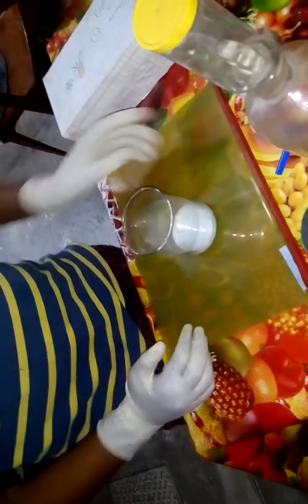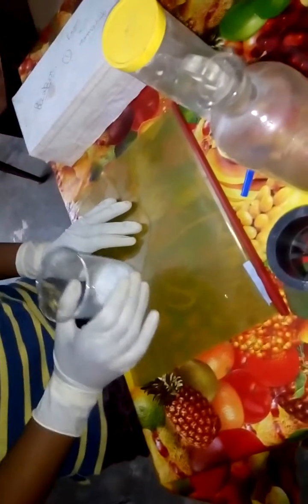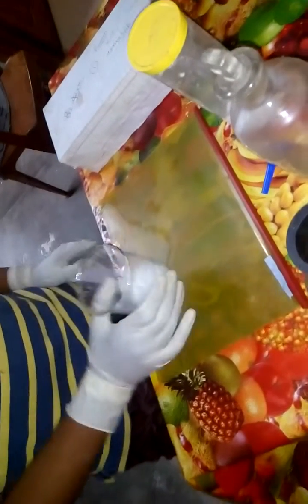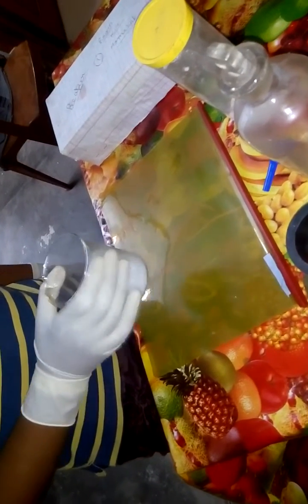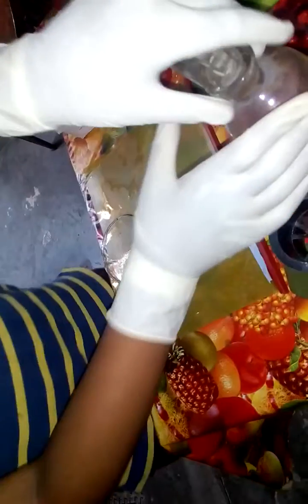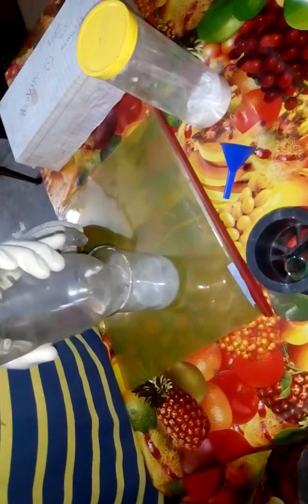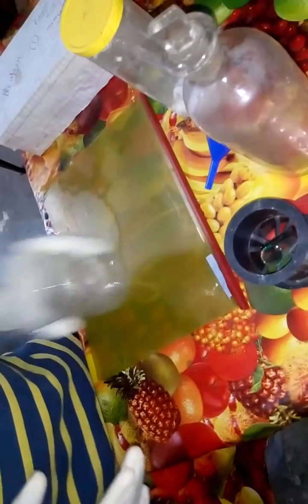You have to wait 10 minutes. Now I am going to put some more sulfuric acid into the beaker. Now we have a proper solution of sodium sulfate.